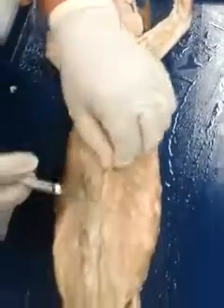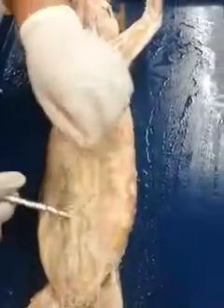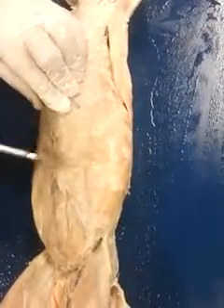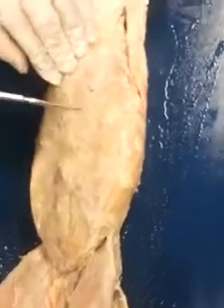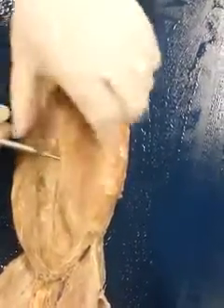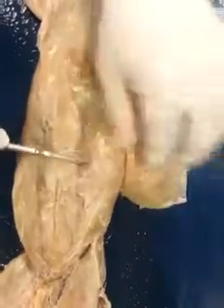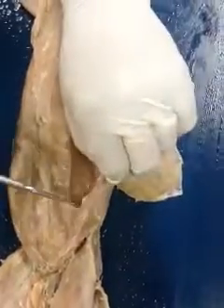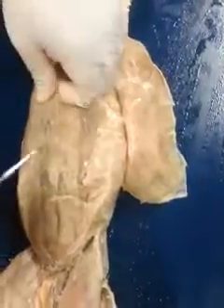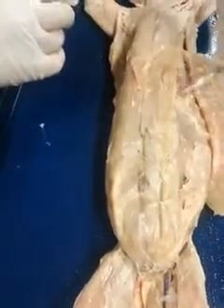Moving down from there, you get into the abdomen. In the abdomen, you're going to have 4 muscles that you're going to want to find or identify. The first one, and you want to pay attention to the fibers here as well, is the external oblique. External oblique. So that's that guy there. As we go deep to the external oblique, you have your internal obliques. So that's 2. And the third muscle here is going to be this long band-like muscle, the rectus abdominis.